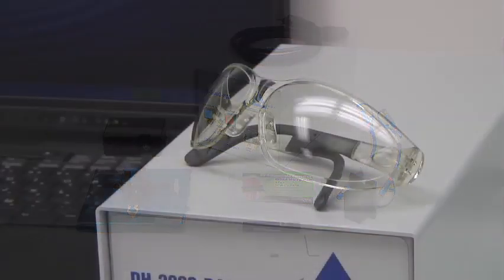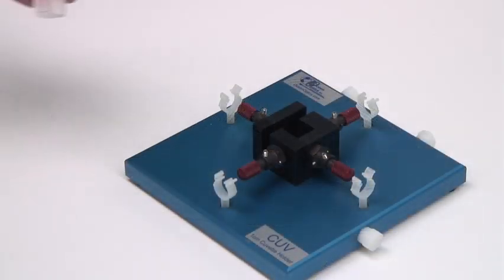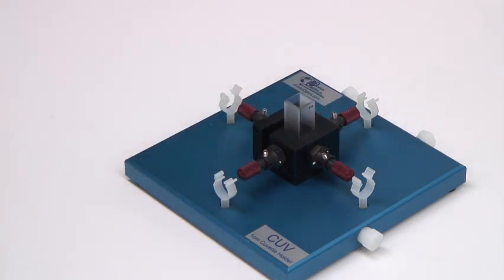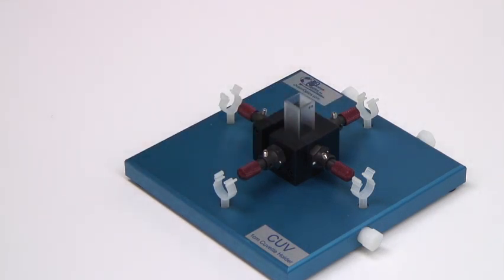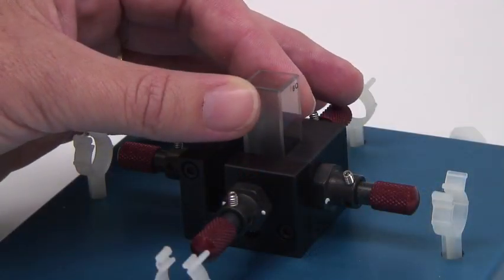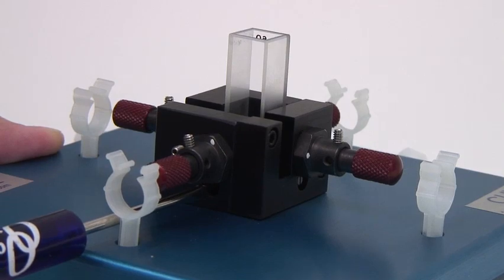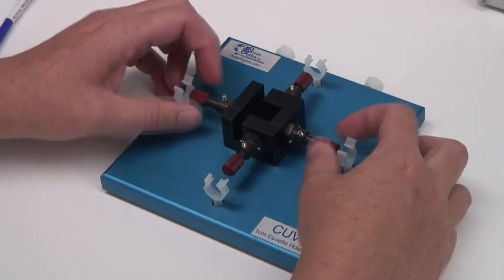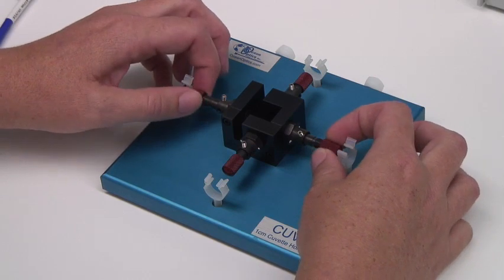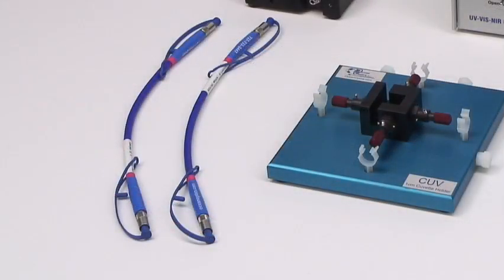A power cord and UV protective glasses are also included. Because acetone absorbs in the UV range, we'll load our sample in a 1 cm path length quartz cuvette. We use quartz because it transmits UV light. The cuvette will fit into our CUV-ALL cuvette holder. The holder has collimating lenses that couple to optical fibers for straight-through absorbance measurements, as well as for scattering or fluorescence measurements.